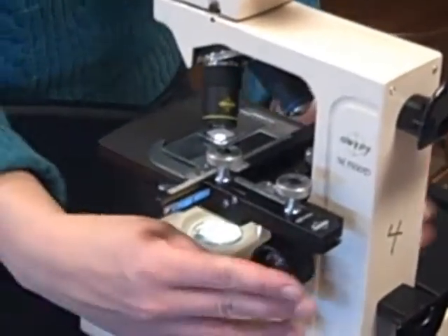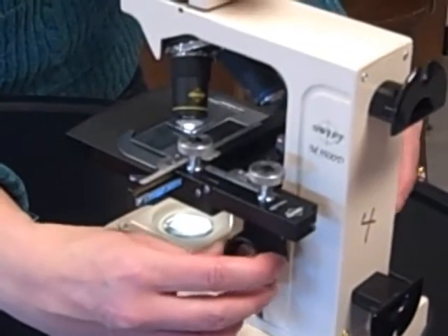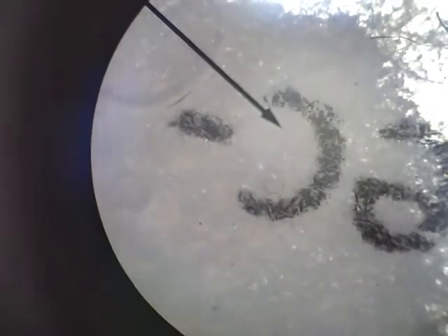Notice that I have the coarse adjustment as far away from the objective as possible, and then we're going to go ahead and roll it all the way up before we look in to focus it. Here's our EC, and we're rolled all the way up. I'm going to roll down to bring it in focus and use my fine adjustment — and that looks pretty good to me. I'm going to further center my E right in the middle here. Notice you can also see the fibers of the paper, which look pretty neat.